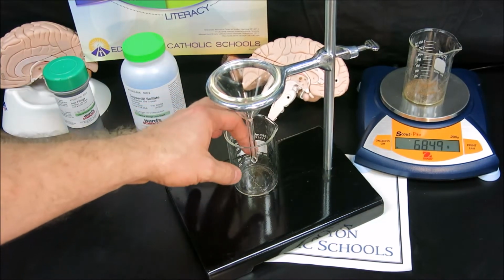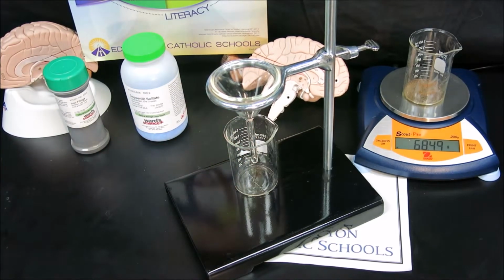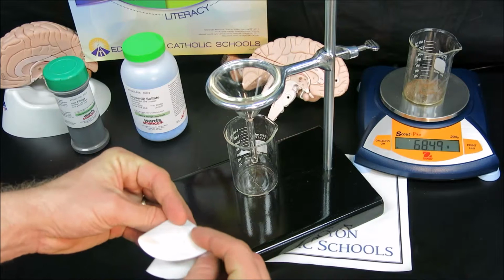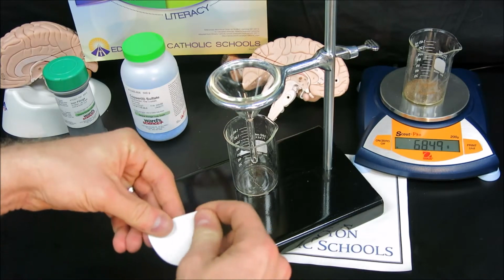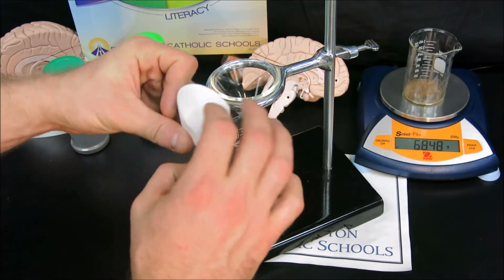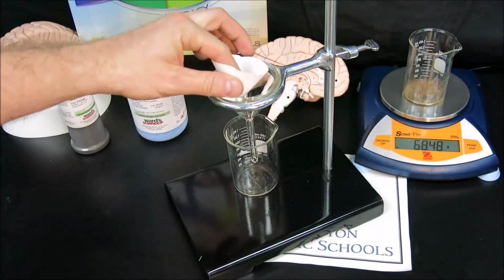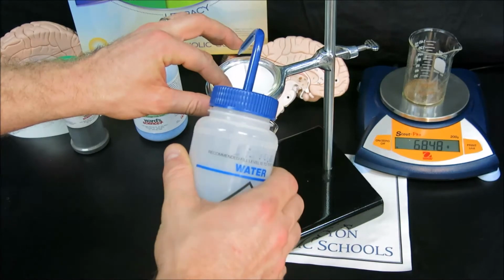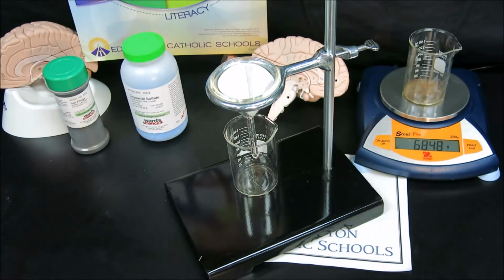right at the bottom. Now, why is it important for the funnel to touch the beaker? Again, think of the properties of water and the concept of adhesion. You then take a piece of filter paper and folding it twice form a cone shape. And then opening up that cone shape will provide you a filtration area. So placing it inside the funnel, the easiest way to keep it inside the funnel is to use just the slightest amount of water on the upper edges of the funnel. And what this does, again, using the properties of water and the concept of adhesion, is it sticks the filter paper right to the sides of the funnel.